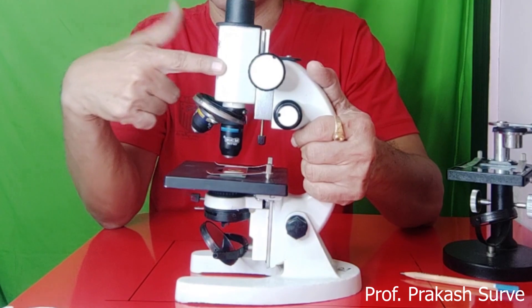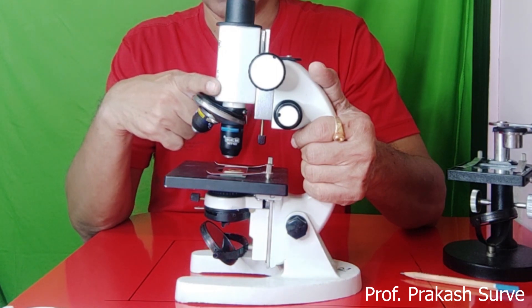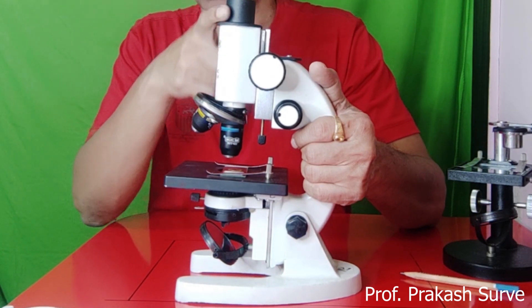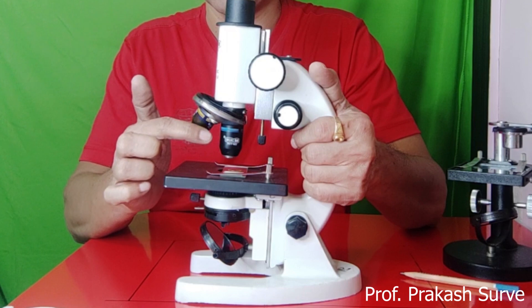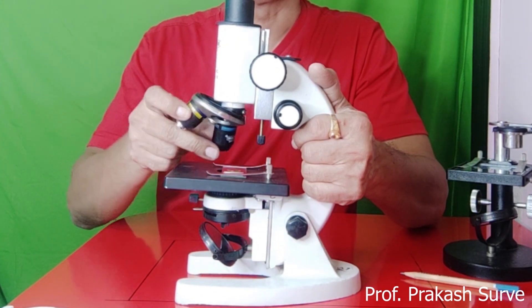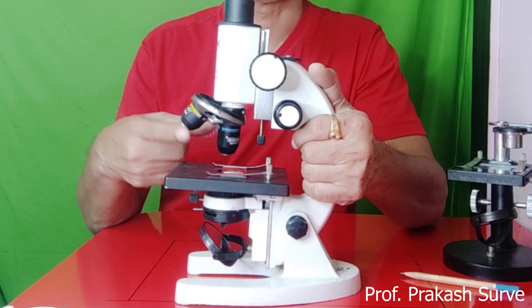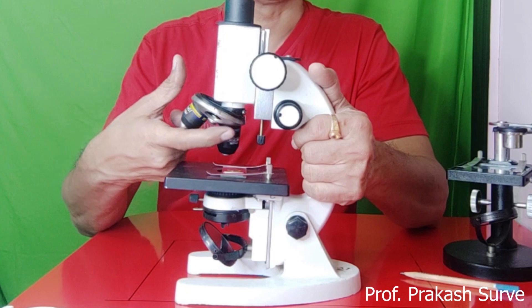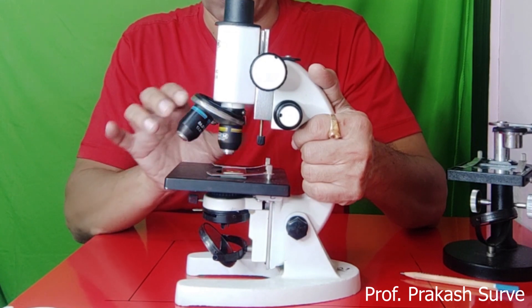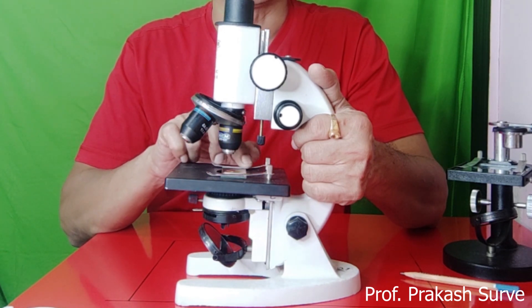Next is the body tube. It holds the ocular and objective lenses at its two ends. At the upper end it holds the ocular lens, which is the eyepiece, while the lower end has two to three objective lenses attached to the nose piece. There are typically three objectives: 10x, 45x, and 100x power. The nose piece can be rotated to adjust the objective according to convenience.